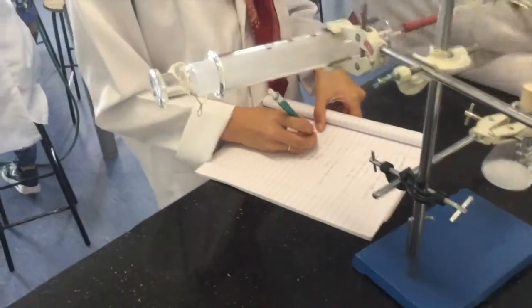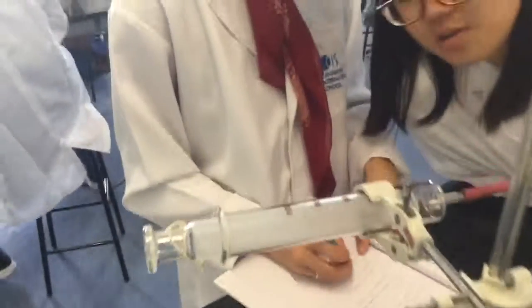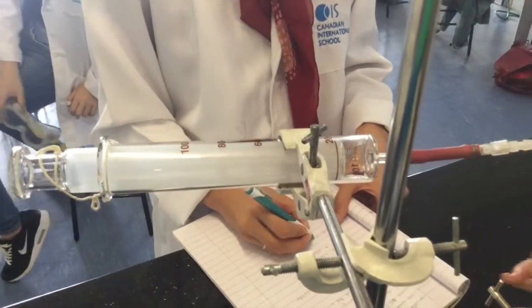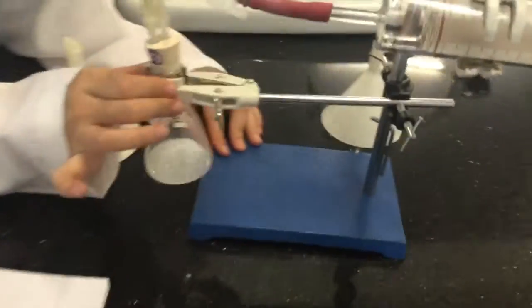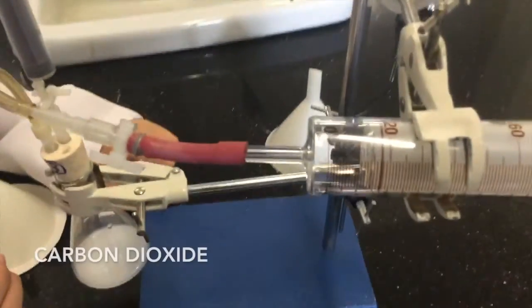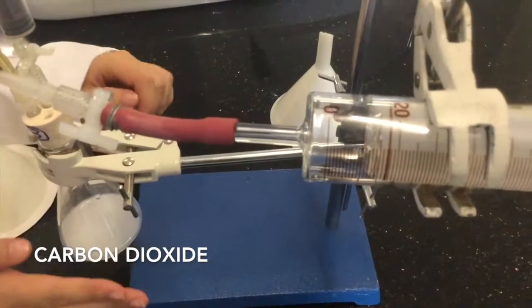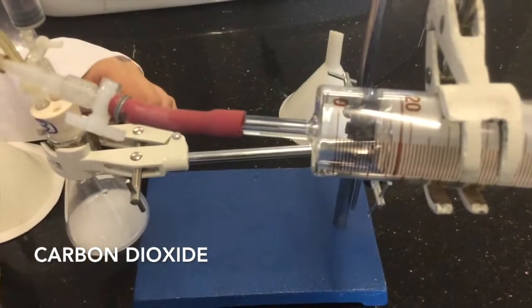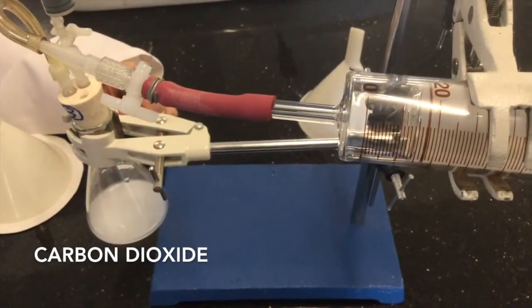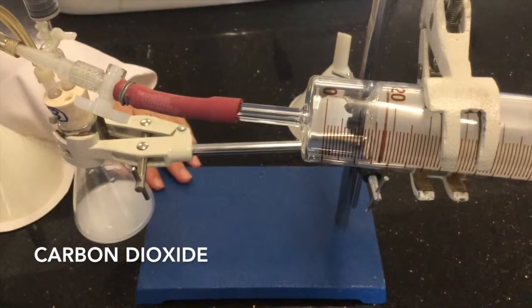You should stop when you have some gas collecting there, right? How much gas — let's see. Is that it? Yes. You can zoom in like that — yes.